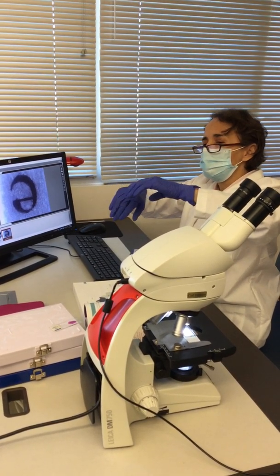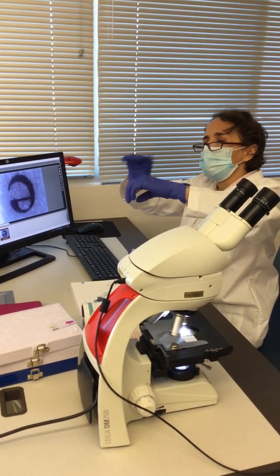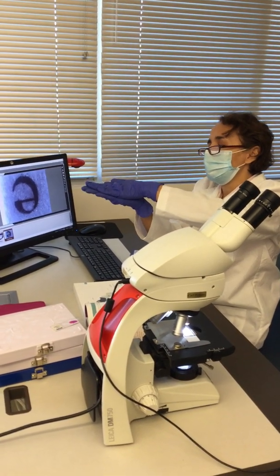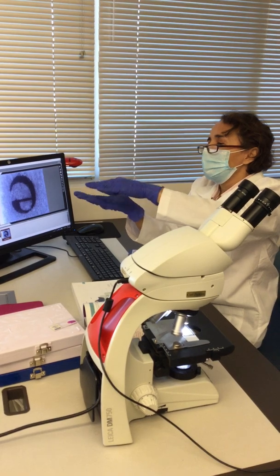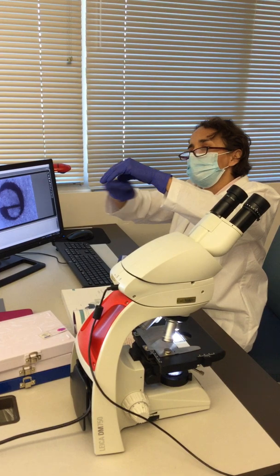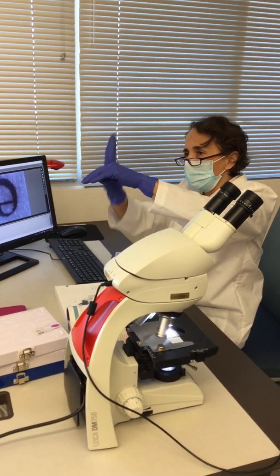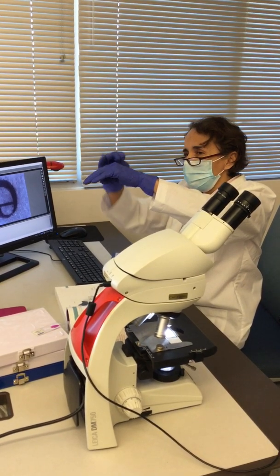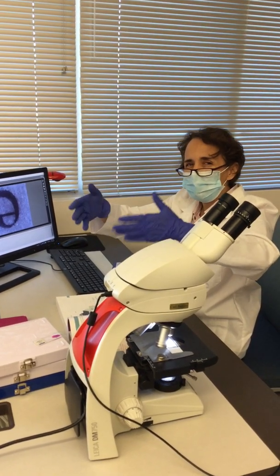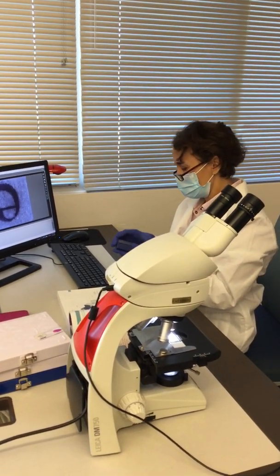But let's say that you have a sample that has a round shape or something, and you're squeezing it between the glass slide and the cover slip. Well, what if you want to see the tip of the round object and you don't want to see the base? In that case, you have to move your stage up and down so you can look at the tip only and not at the base. That's like giving you more of a three-dimensional view or a depth. So that's what we are going to be doing with these colored threads.